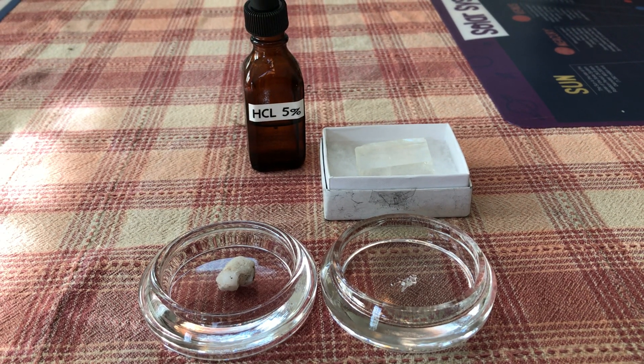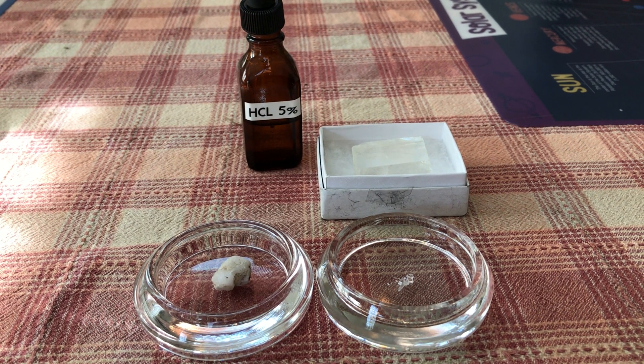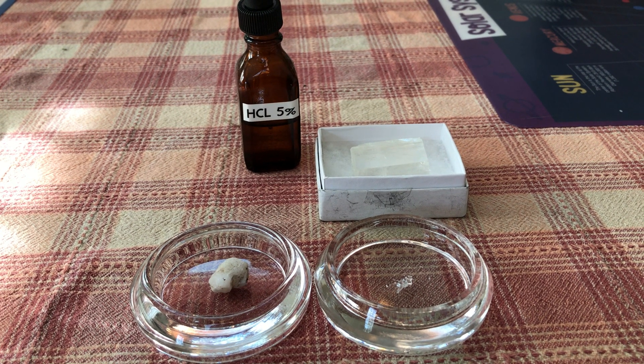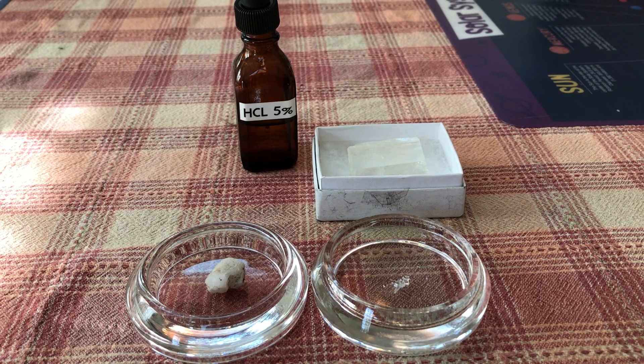Hey ladies and gents, today we are going to demonstrate our acid test for the presence of the mineral calcite in soil and rock samples.